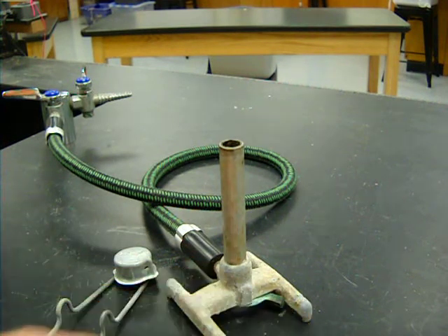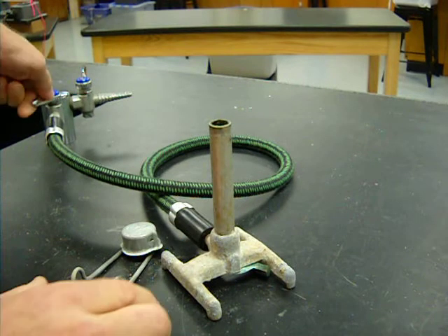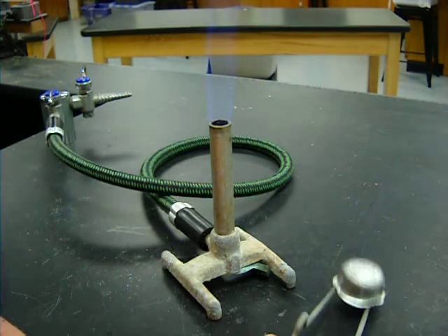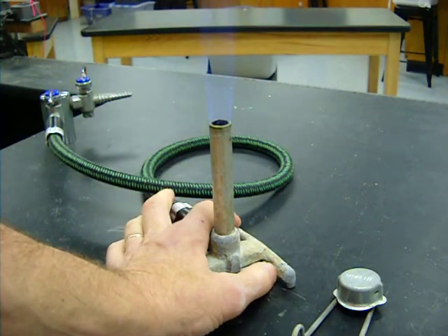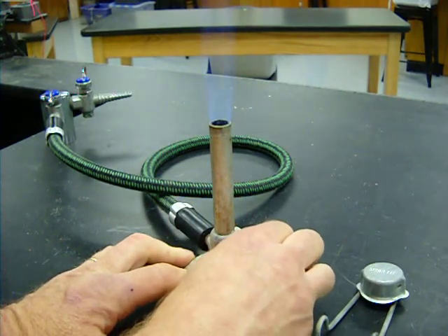I have my air valve closed. I'm going to turn the gas on, strike it, light the flame. Now, I'm going to be a little more cautious about adding air this time. Let me add some and get that flame going a little bit.